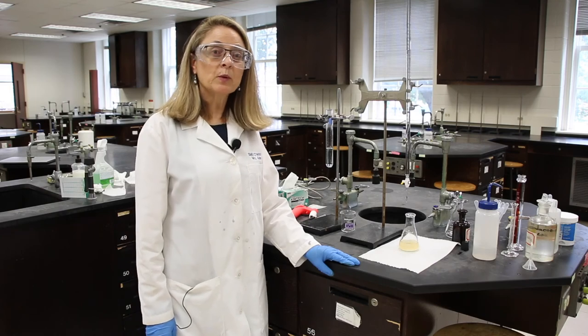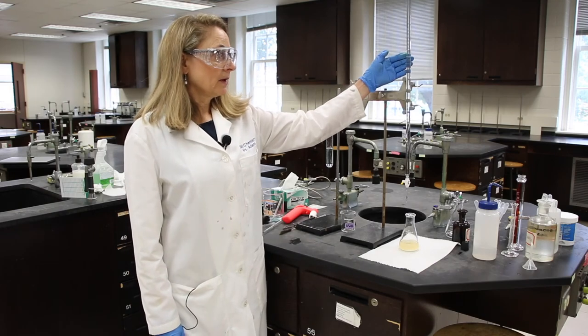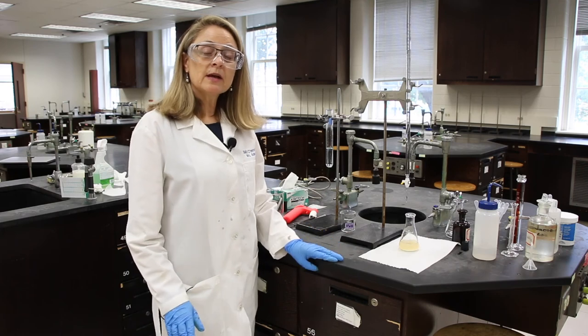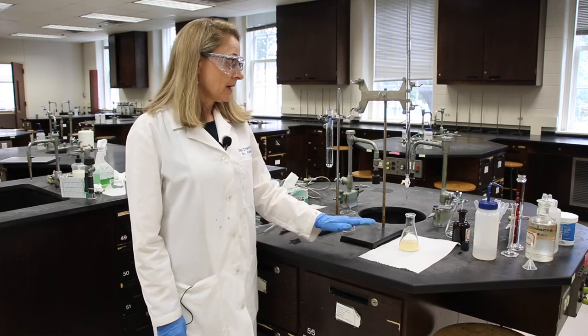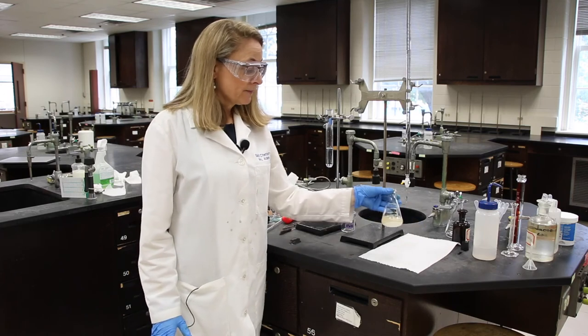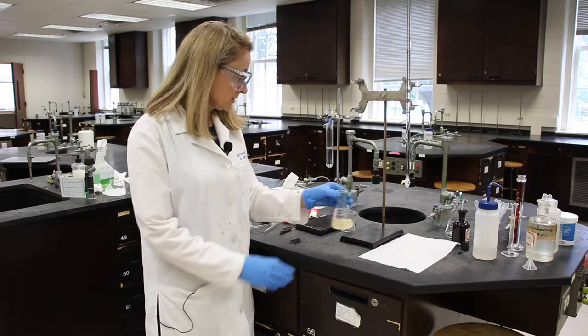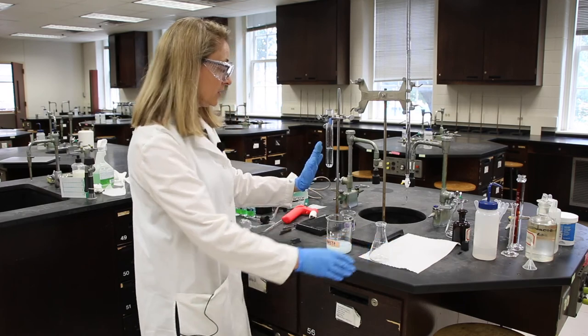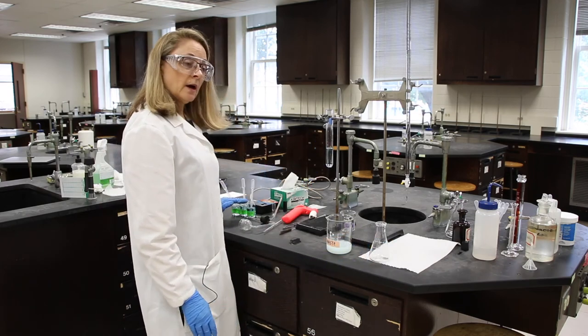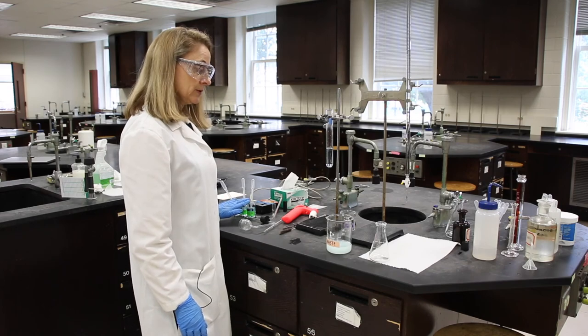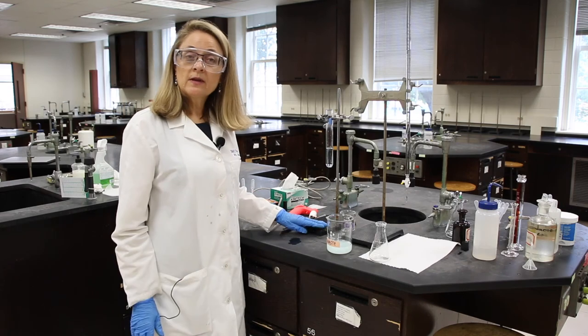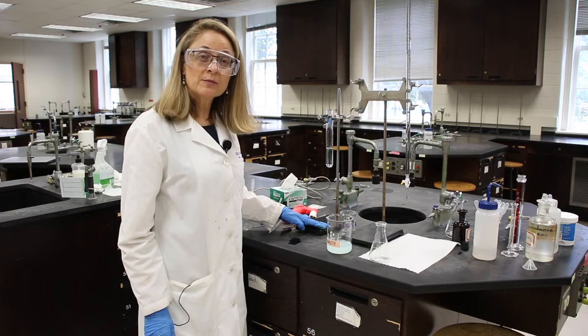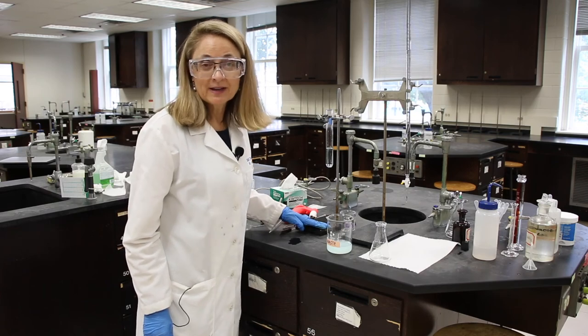Now that we're done with the experiment, we can clean up. The remaining potassium thiocyanate in your burette can be put down the drain. But anything that has contained the copper or silver, anything that has been in the alloy, needs to go to hazardous waste. So we'll put it in our collection beaker, including your sample and any of the known copper solutions. That all goes to hazardous waste, and then that gets transferred to the large hazardous waste carboy in the back hood. You can now complete your calculations. Thank you for being my lab partner today.